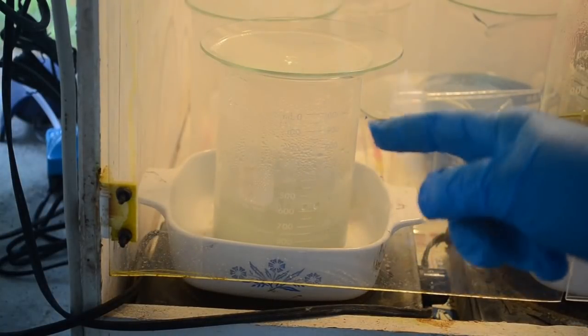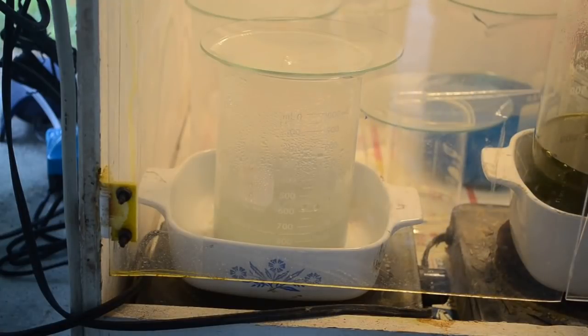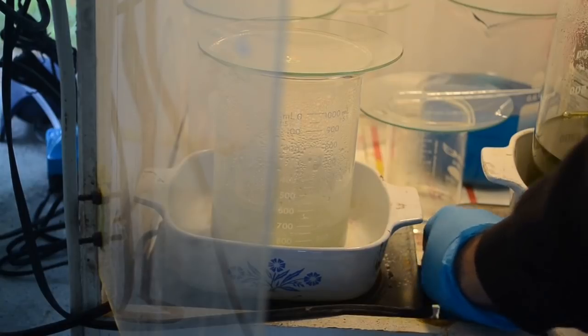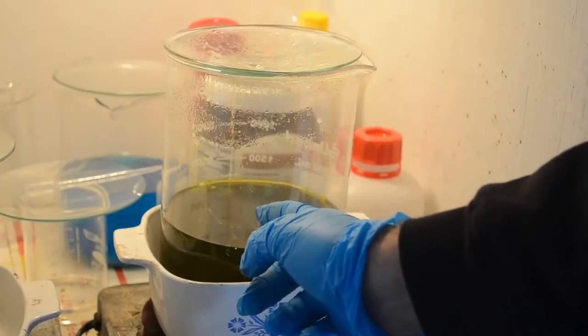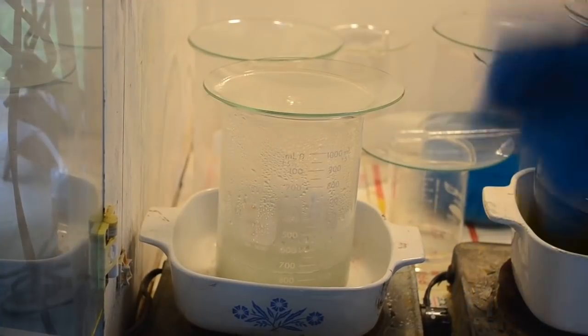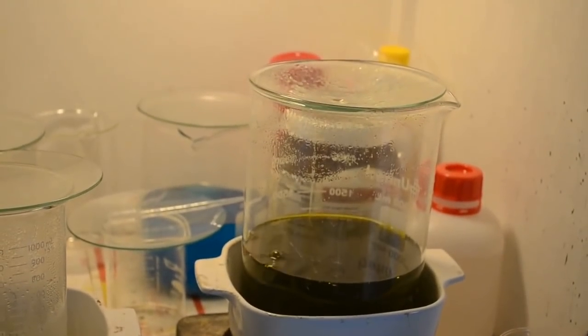Okay, my strategy with this isn't working. Yeah, the boiling gets some of the silver chloride suspended in the water, but as I pour it off, I can see that I'm only getting a tiny fraction of it out, and I'm dragging some gold over too when I pour it out. So I poured it all back into this beaker, and I'm just going to stop with the boiling. It's just not working. And I'll let this cool down. And what I'll do is my second idea, which is when I get the gold from this solution, I'll add it to this beaker with this mess and redissolve everything in aqua regia and filter it really well to get rid of that silver chloride mess. Okay, so that's my new plan.